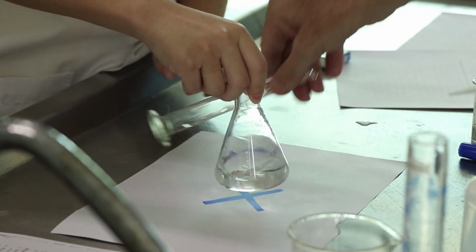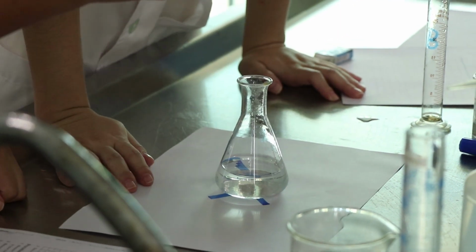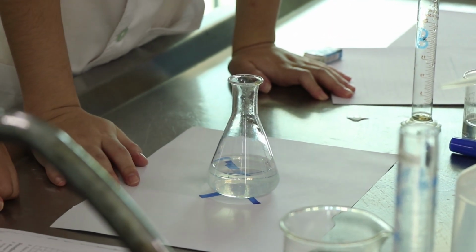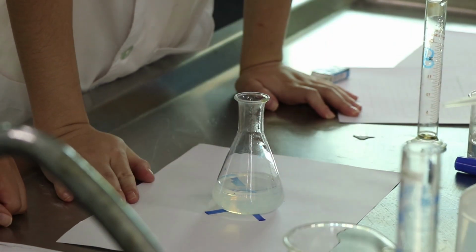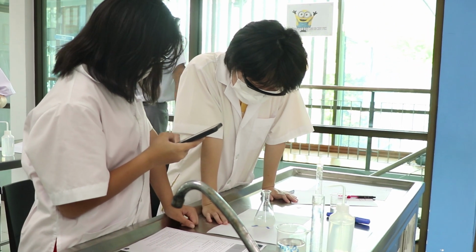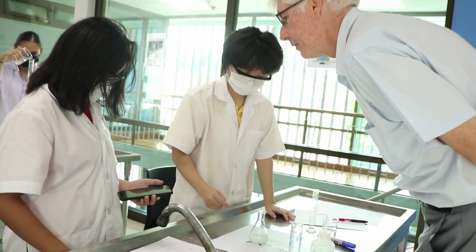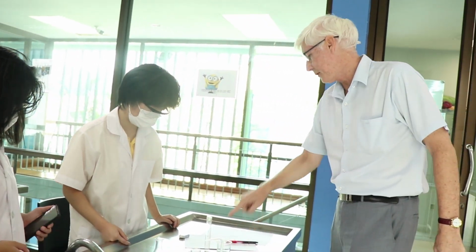Now, good. Now, look down it, and as soon as you cannot see the cross, you stop. Yeah? Alright, so 40, and then you use this to top up to 10, up to 50, yeah? Always 5. Okay, how many seconds? 22 seconds, so you write 22 seconds.